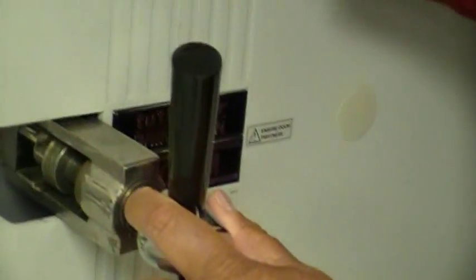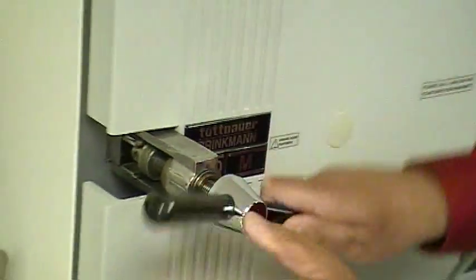Okay, it's ready. So you close this, turn it to sterile, and you put this latch on here on the door and you turn it.